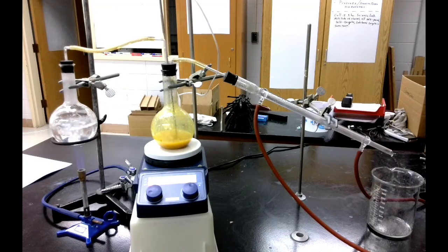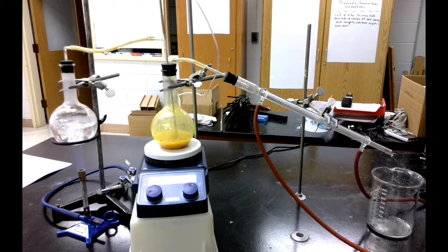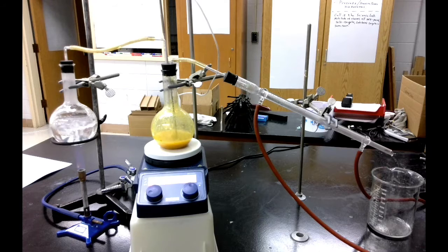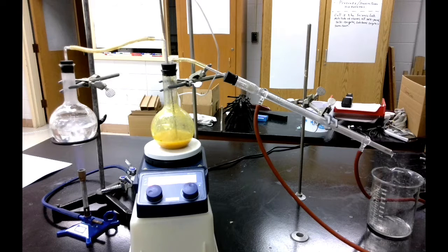All right, I've got my steam distillation set up and running. We're going to briefly go over how this whole thing is working and operating, and then we're going to look at each part and just how to put this all together.